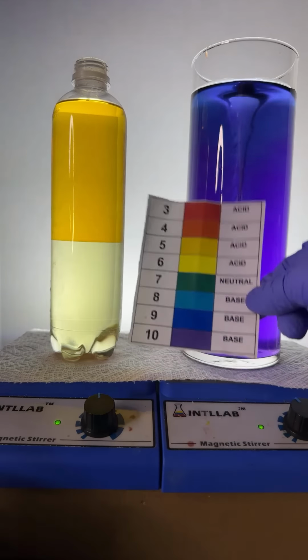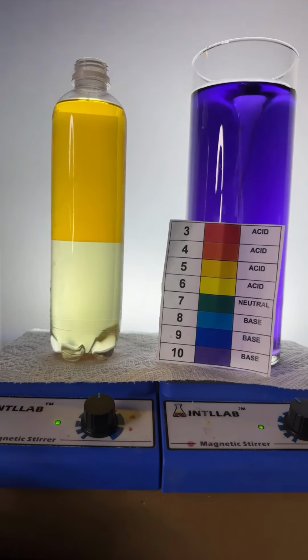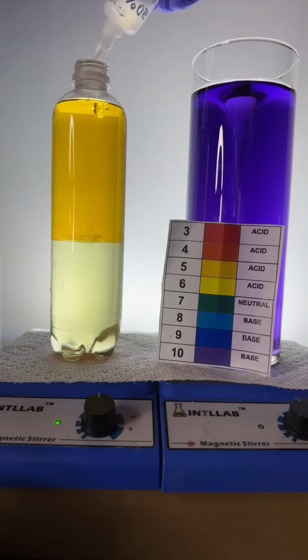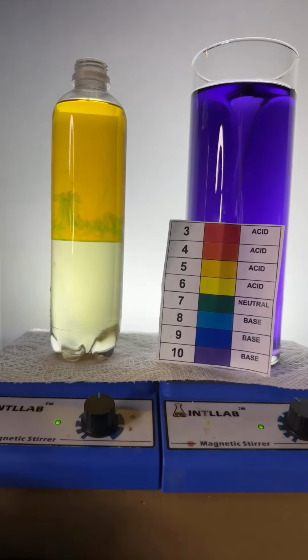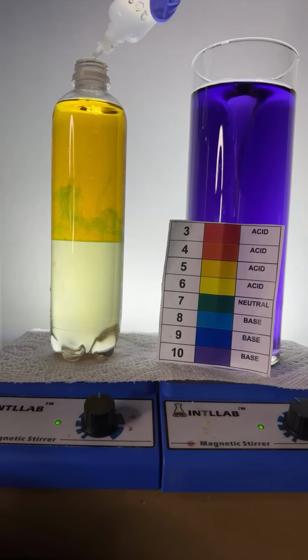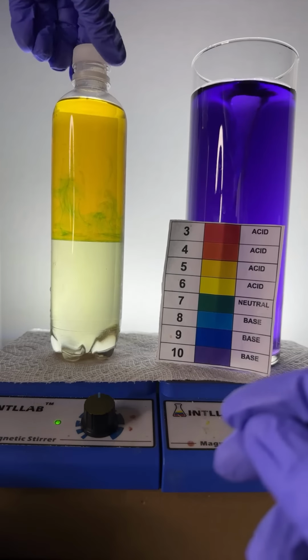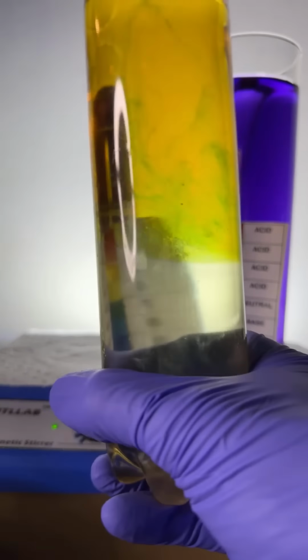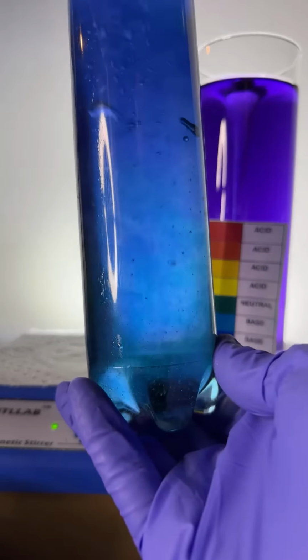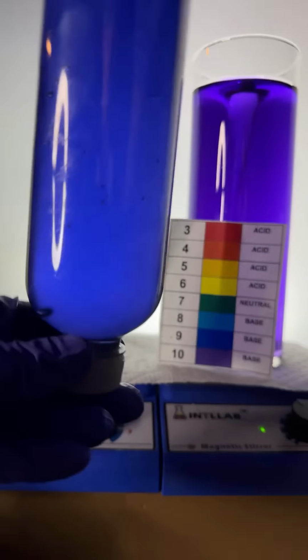So that's what I'm going to start adding over here on the right. We're at like a pH of 6. I'm going to add like 2 or 3 drops of base. Craig, the base that I'm using is sodium hydroxide. Let's go 1, 2, 3. Let's add a bunch. There we go. Oh, that's nice. You can see the sodium hydroxide solution is more dense than the alcohol, but less dense than the salt water. You can see it made a little bit of greenish color. I'm going to add just a little bit more. There we go. Let's see what happens when I shake this up. All right, shake that up. Hey, look at that. We got a blue color. Beautiful blue.